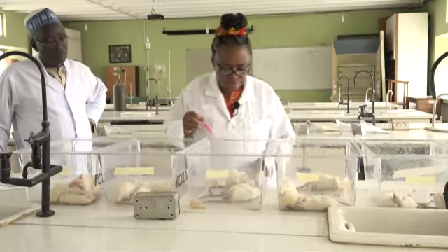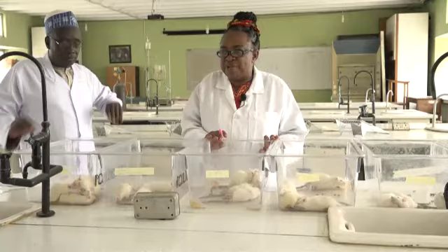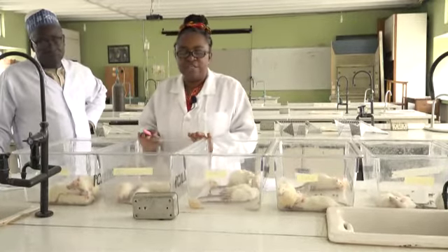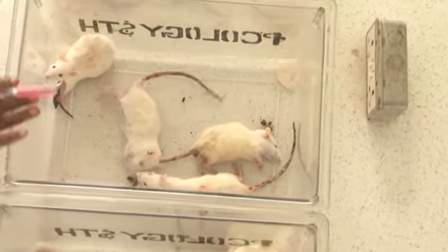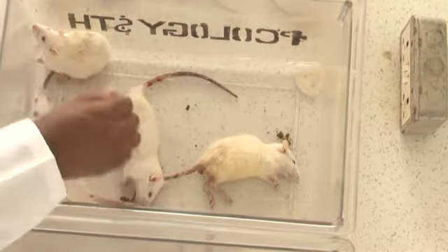I hope you can see that the one that received no treatment at all and the one that received treatment, that is atropine, immediately after the poisoning both suffered toxicity. But the one that received treatment is suffering less toxicity.